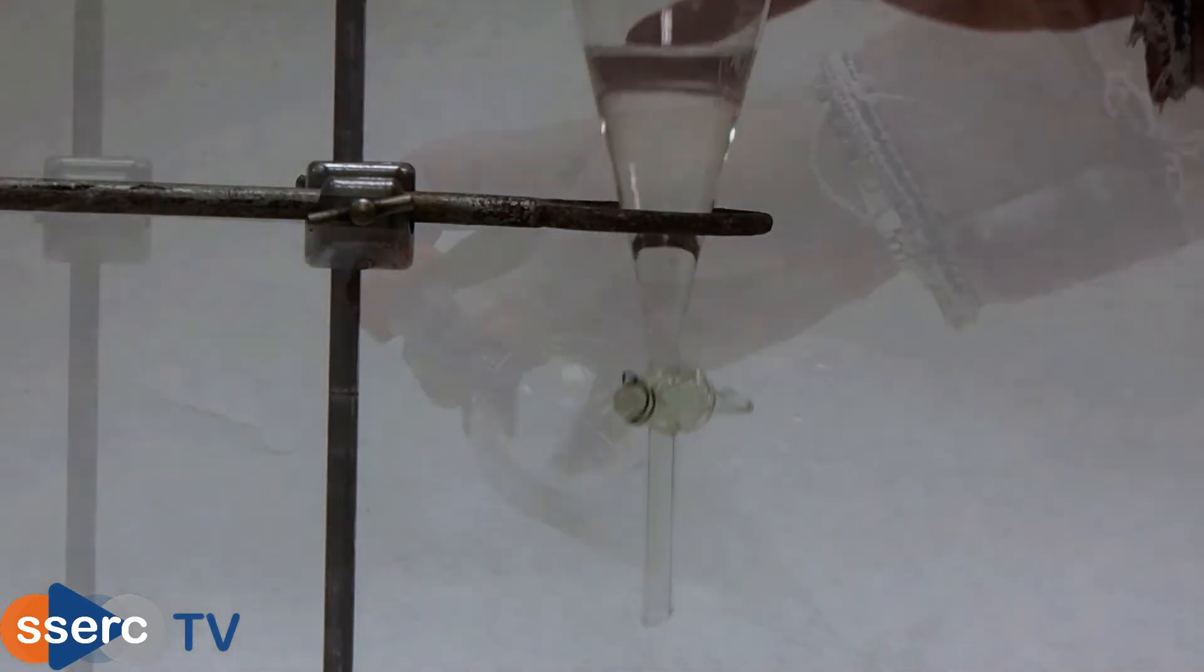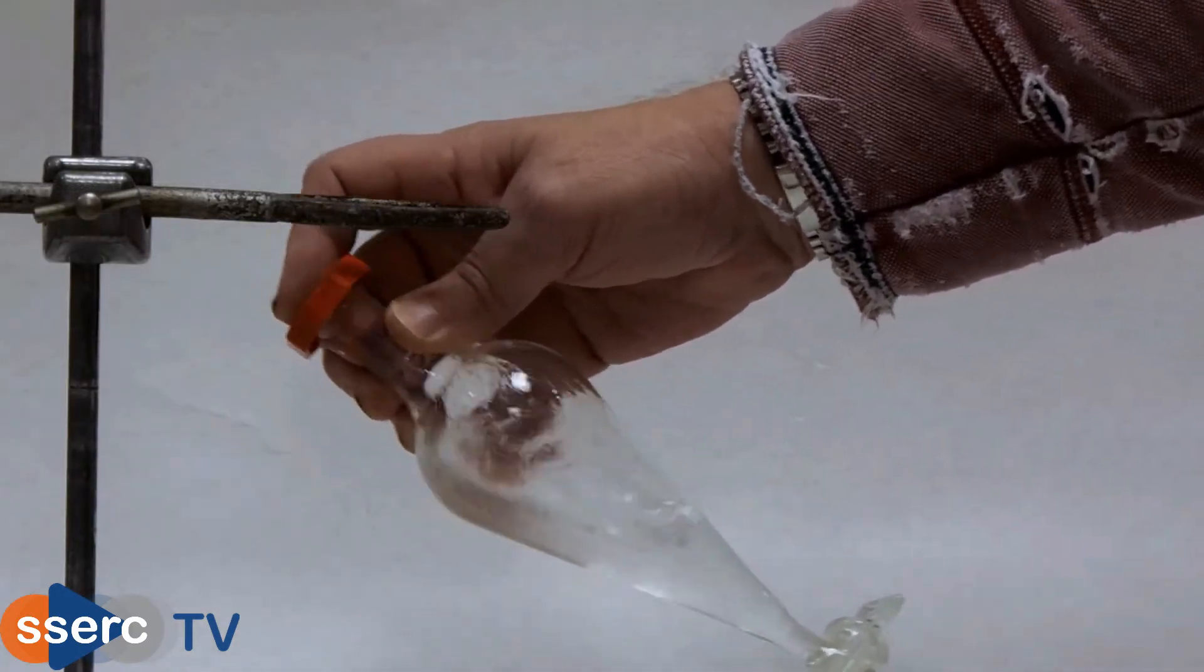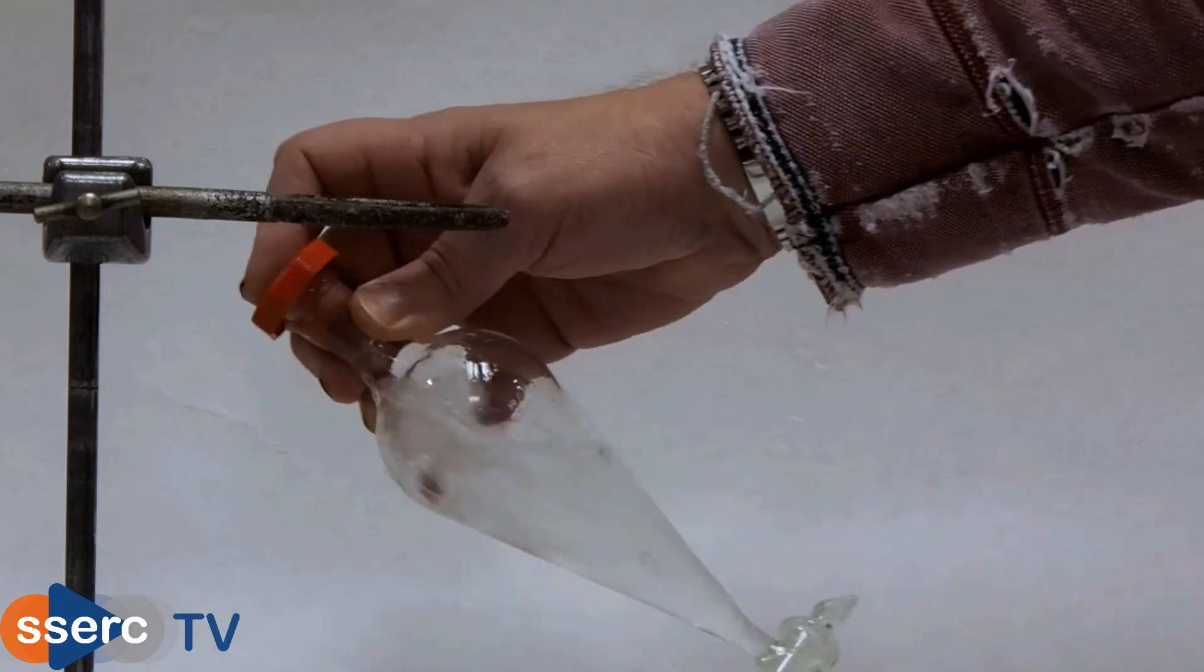Now put the lid on the funnel and shake or swirl the contents gently. You may need to remove the lid occasionally to prevent pressure buildup.